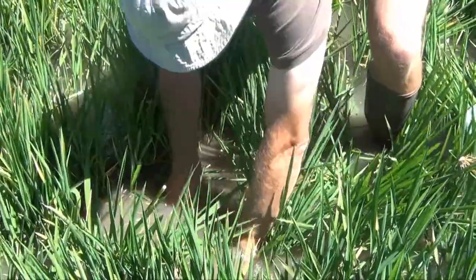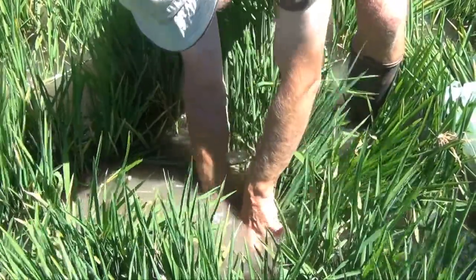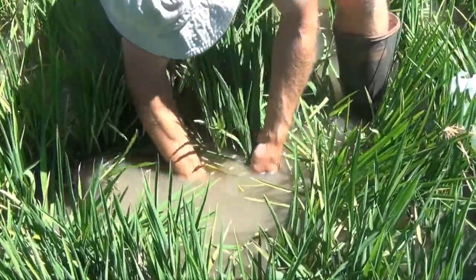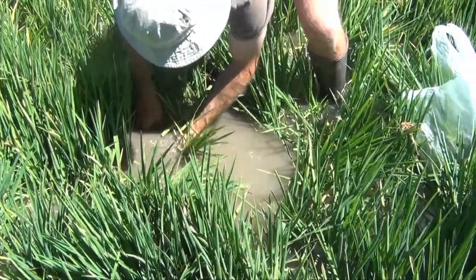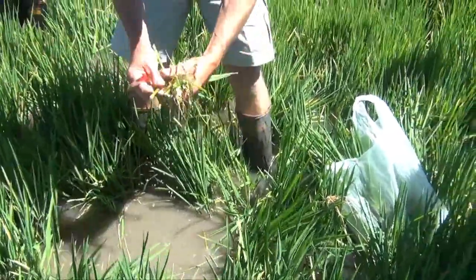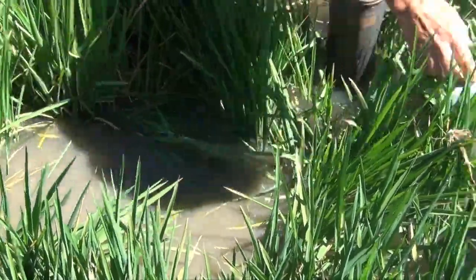Once you've got that, just work around your edge — your knife will sort of hit up against the edge there. Continue to sample around the outside, keeping all rice that is inside the ring and cutting close to the soil surface.